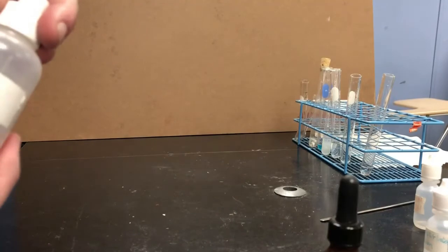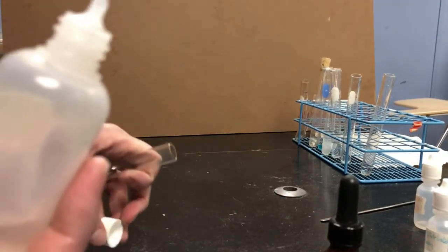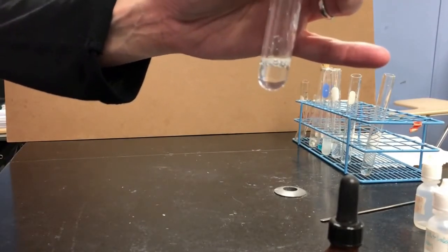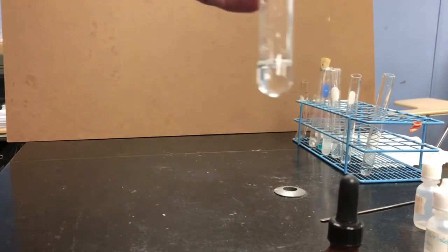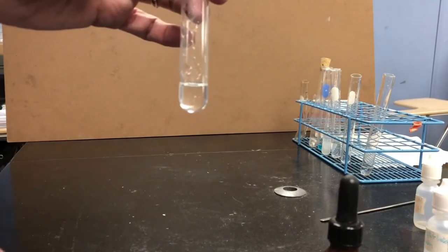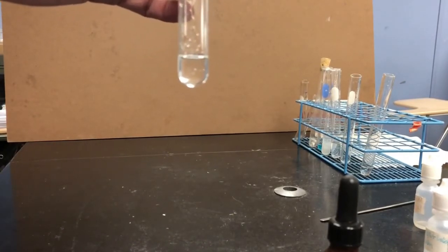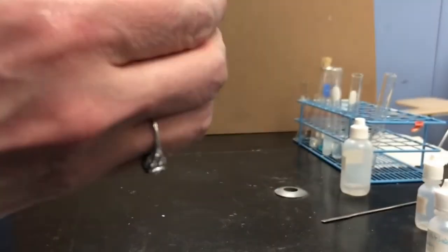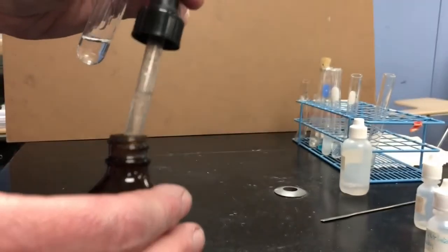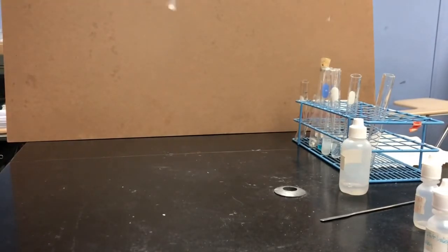Interesting. Reaction 7. I'm going to add calcium chloride to a clean test tube, and calcium chloride again is one of these clear and colorless solutions. Looks like water. Now, the next substance I am going to add is also clear and colorless, but it's light sensitive, so we keep it in a dark bottle so that the light doesn't affect it so much. And so you can see inside the droplet, it is clear and colorless like water. So 2 clear and colorless solutions.